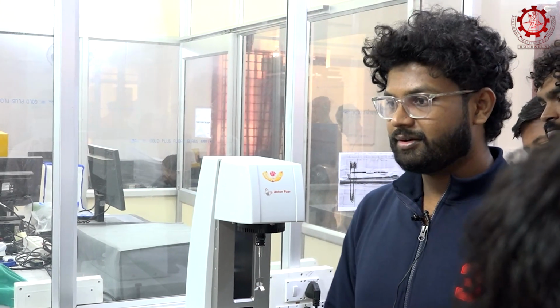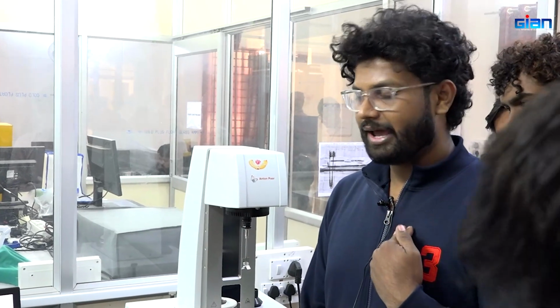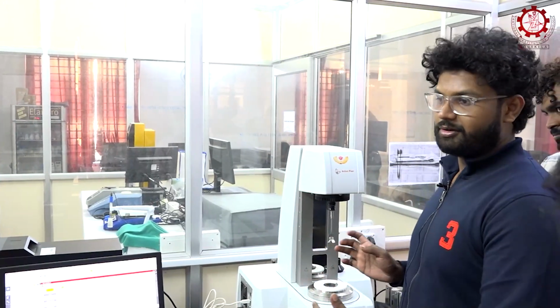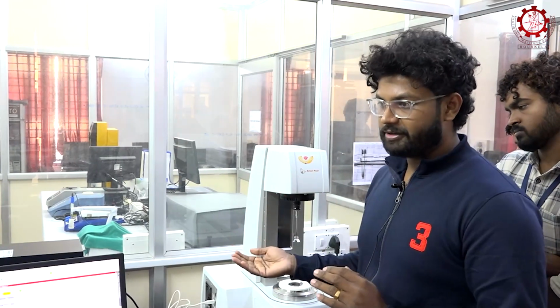Good afternoon all. Today we will be doing pasting properties. Myself Ganga Kishore, I will be explaining how to do this, and this is Shubhanki ma'am. She will be explaining how to demonstrate this. She will be helping with operating.